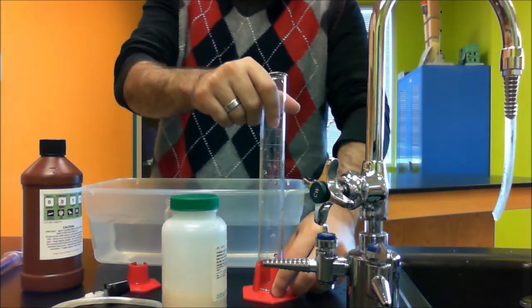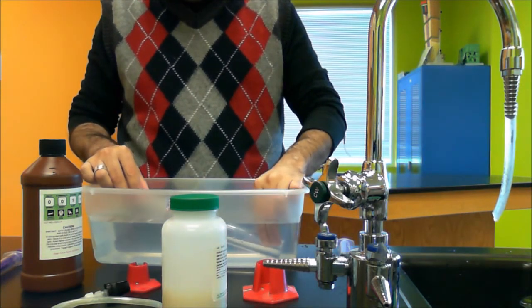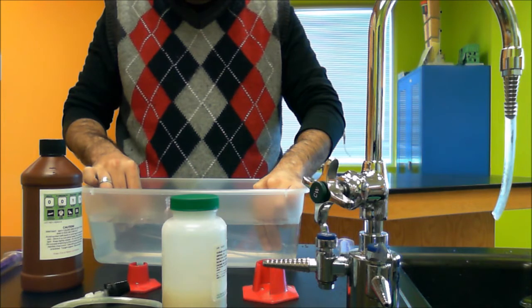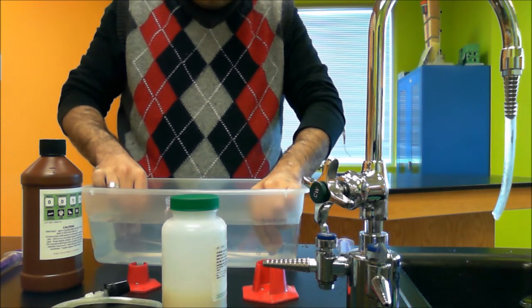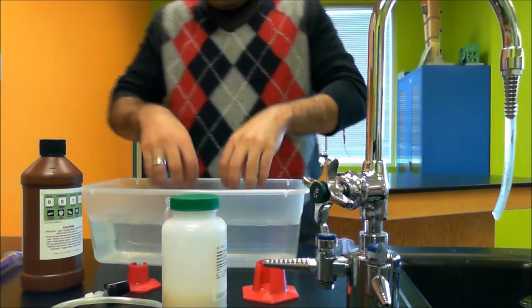Okay, so submerge your graduated cylinder into the sink. Make sure there's no air bubbles in your graduated cylinder.